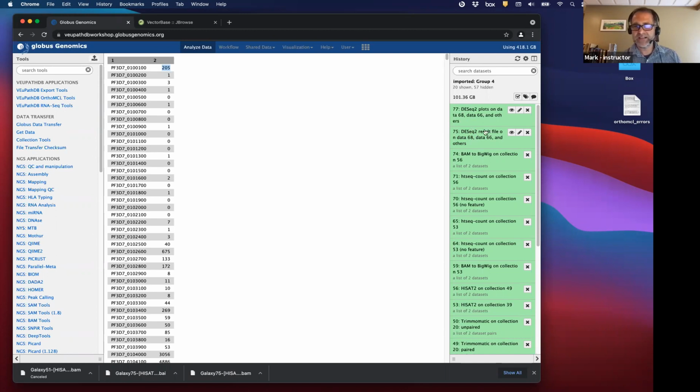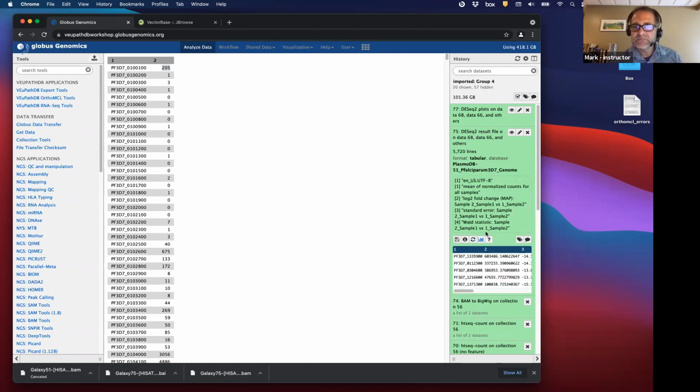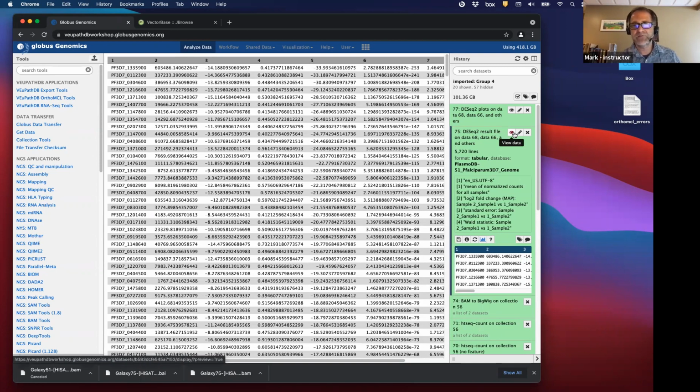So we'll look at DESeq2. We'll first look at this file, the results file that you'll look at. And here's the gene. This is the number of reads across all the samples. This is actually the fold change between your two, you know how you set up sample A versus sample B. This is the fold change in log2 space. So it went down 2 to the 14th times. I don't know that number, but 2, 4, 8, 16, 32, 64, 128, a lot. It went millions. That's how much it changed.